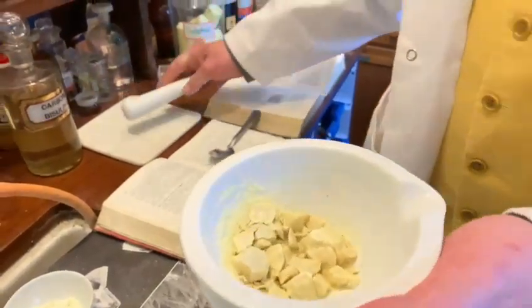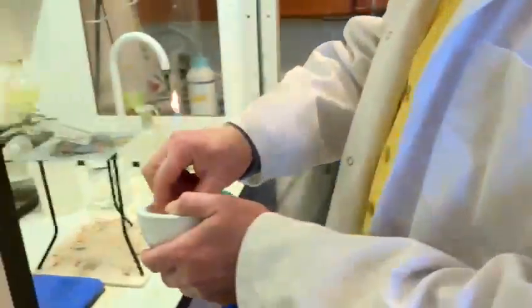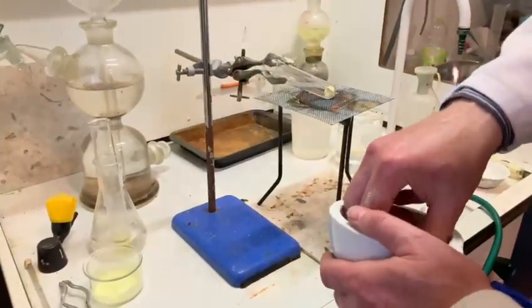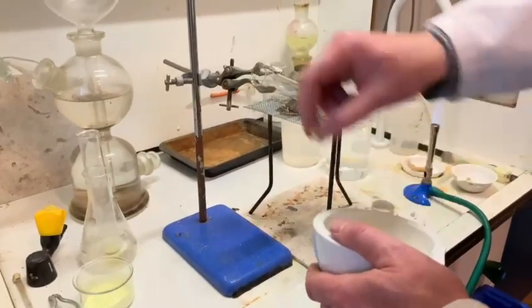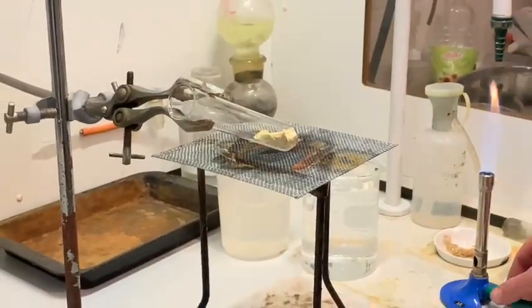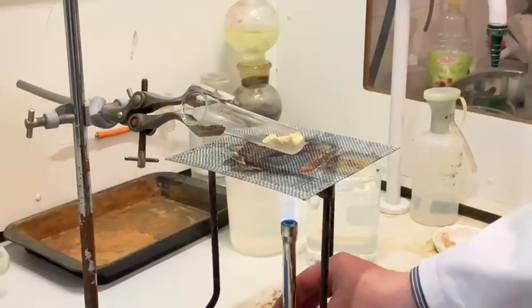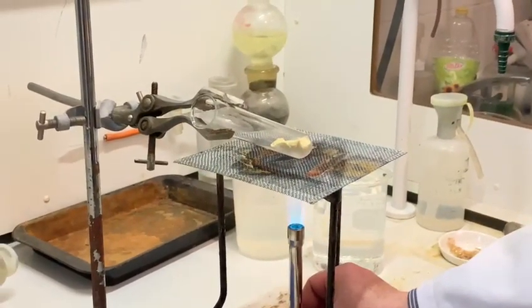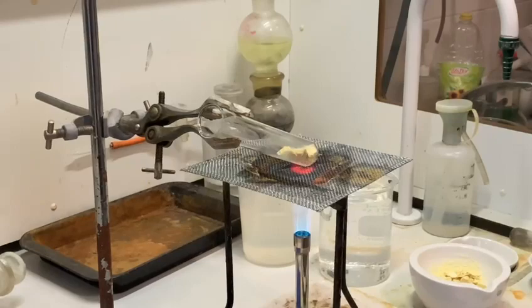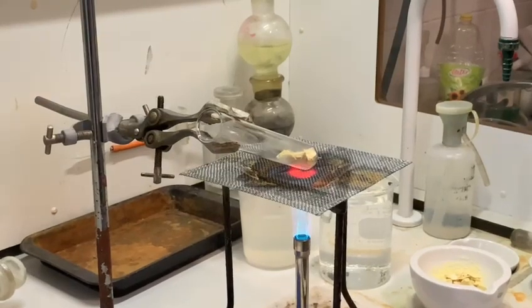My assistant joins me over in the fume cupboard. I'm putting some sulfur into this boiling tube and we're going to heat it up and see what begins to happen when we heat the element sulfur. We'll put the Bunsen burner under it here and get it going.